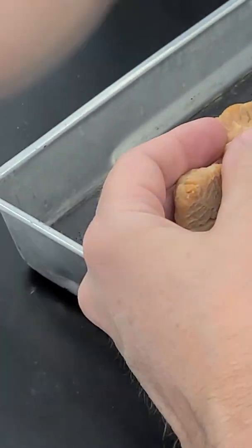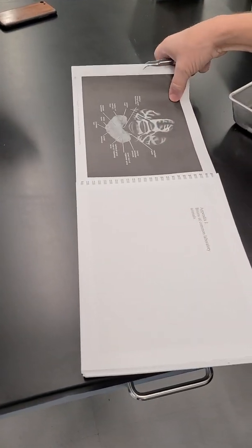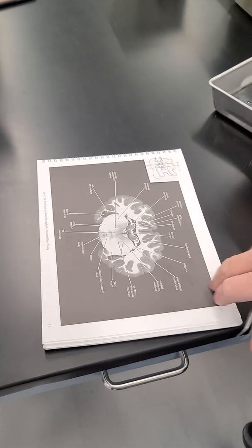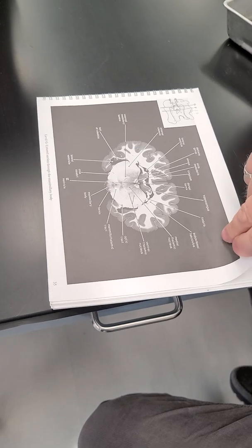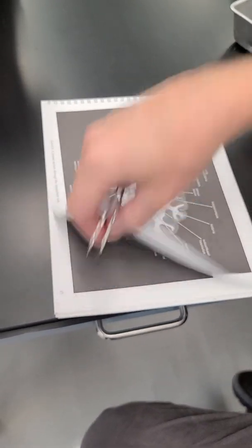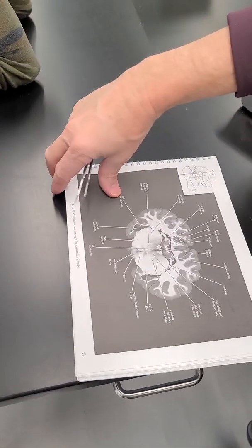And so when you're looking in the coronal sections, that makes like a C with the hippocampus, but the other way. So if you're looking at the coronal sections, let's move the next one forward here. Oh wait, forward is the other way.